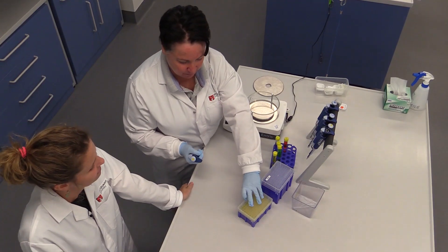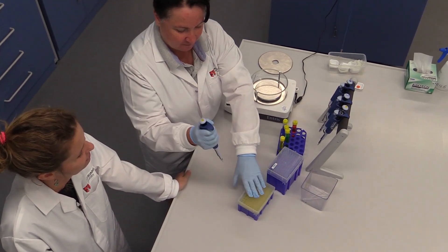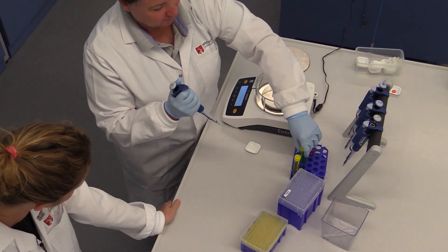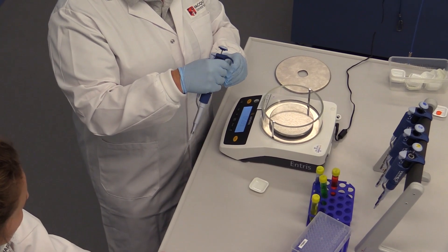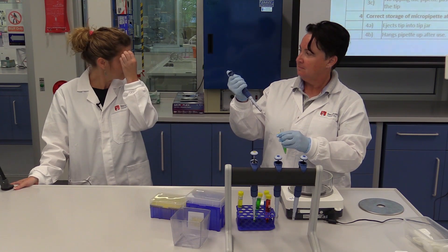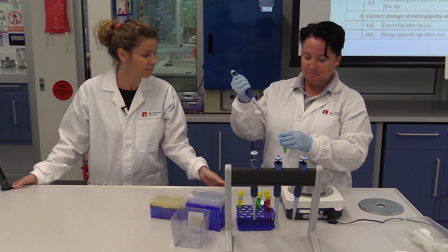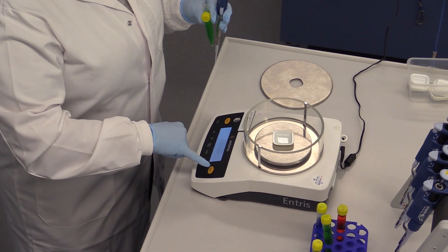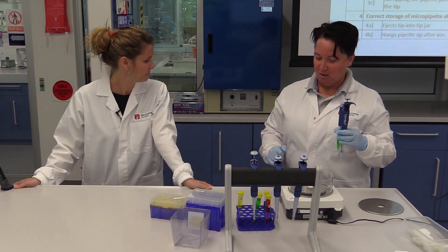Okay, so I'm going to take the tip. Like that. So, green or yellow? Green. Green? Green, yeah. All right. It's a weighing exercise, so you might need to get your balance set up. That's all right. Perfect.